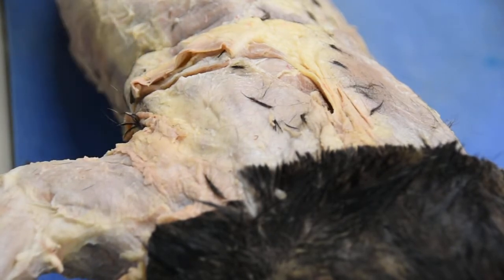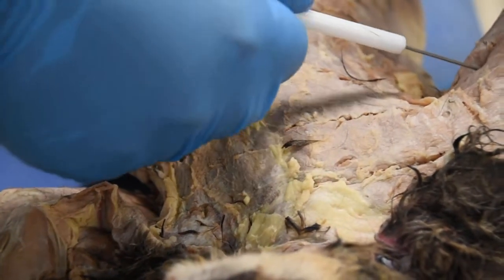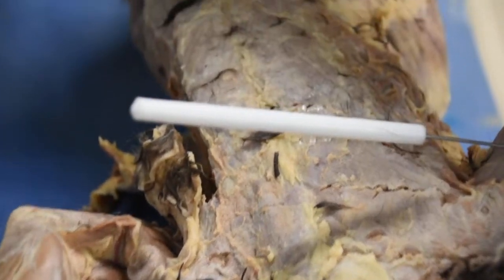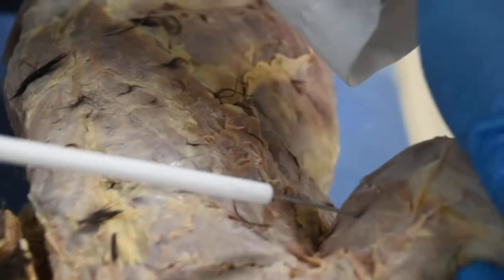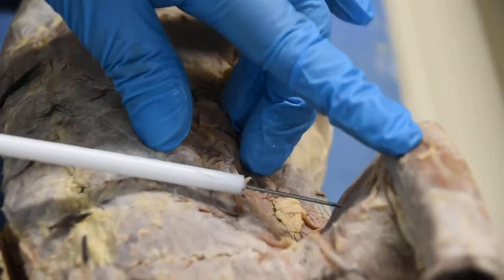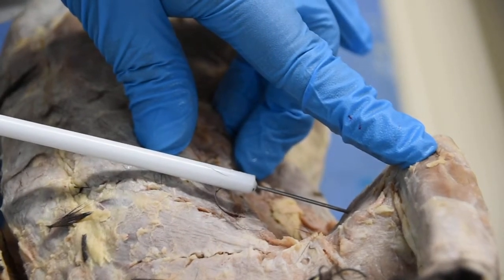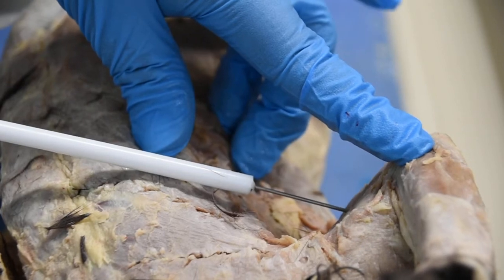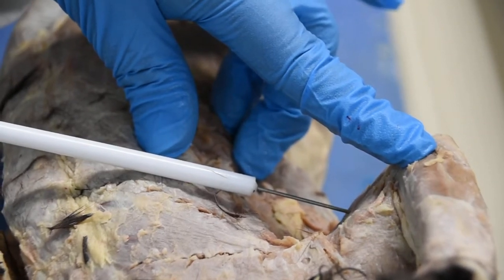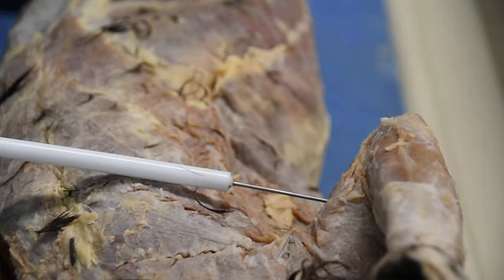And again, if I flip my cat and look at the inside of the arm, right here, this head would be your triceps brachii medial head. So when you're talking about the three heads of the triceps, there are the medial head, the long head, and the lateral head. Make sure you guys identify these muscles.